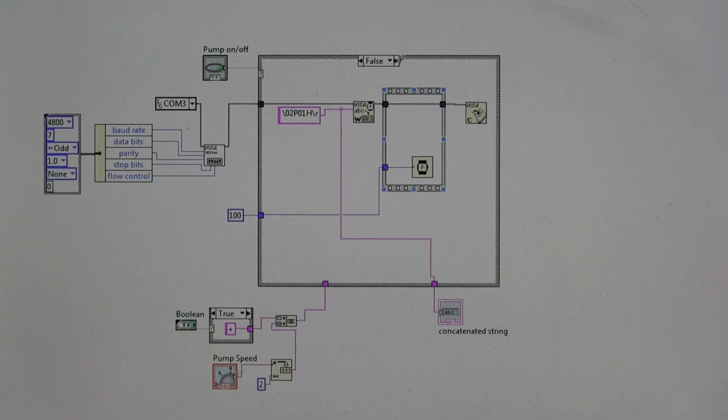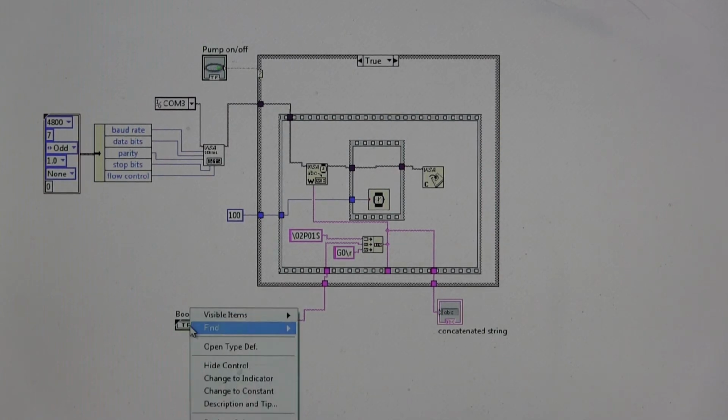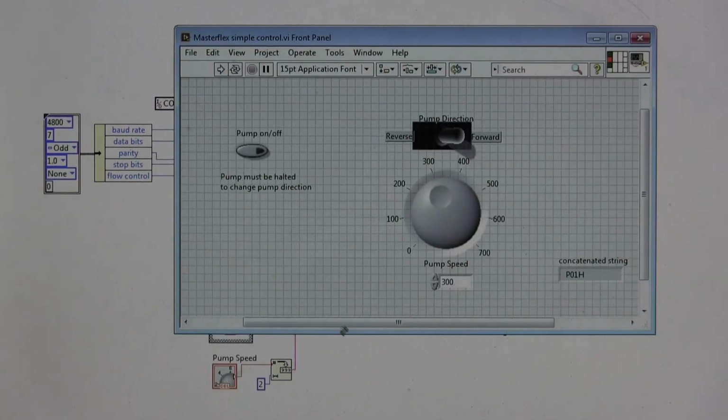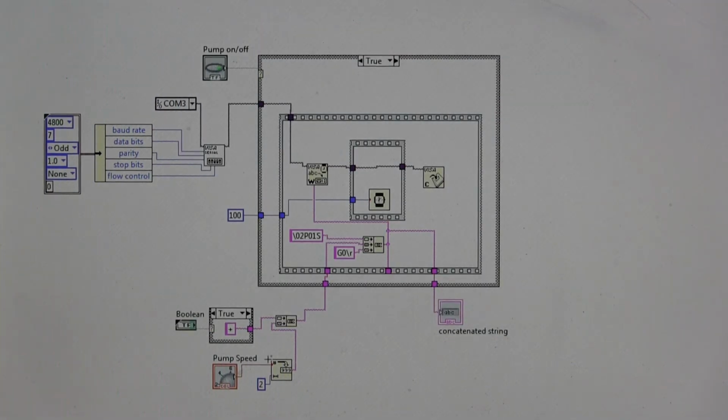Now let's look at the true case. True case is a little more complex because we have to do several things when we want to tell the pump to operate. Let's start down here. This is where it really begins. We have a Boolean true false, and what is this guy? Let's go find the control there. Okay, this is the pump direction, reverse or forward. Forward for true, and false for reverse.